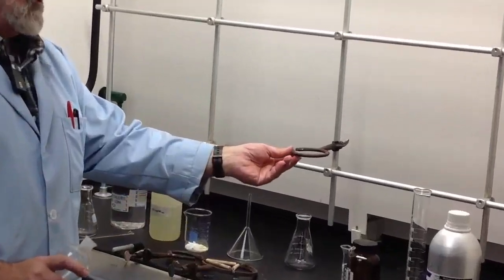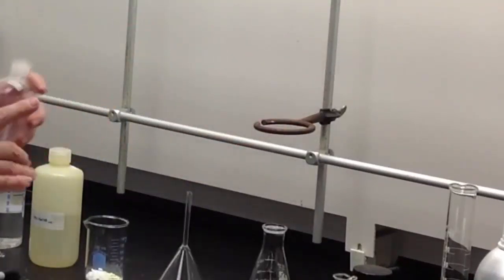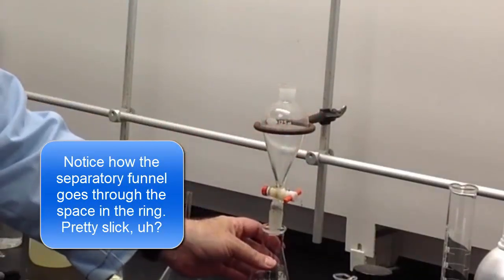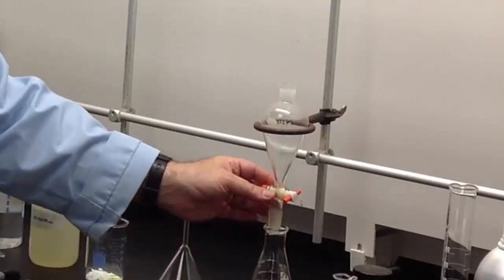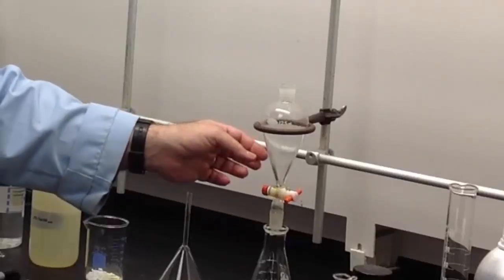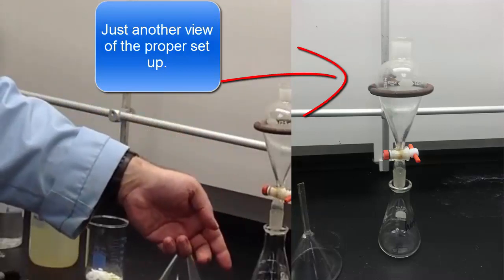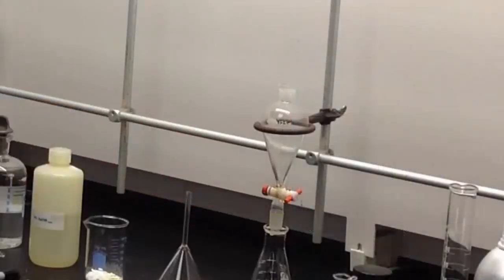Lastly, put the ring clamp onto the monkey bars in the hood, and you want to put that at such a level so that when the separatory funnel is in the ring clamp, you have space underneath for the Erlenmeyer flask to sit. Notice that the separatory funnel goes inside the Erlenmeyer flask a little bit. That helps to make sure that any liquid that drains from the separatory funnel into the Erlenmeyer flask actually goes in, as opposed to spilling out over the edge.